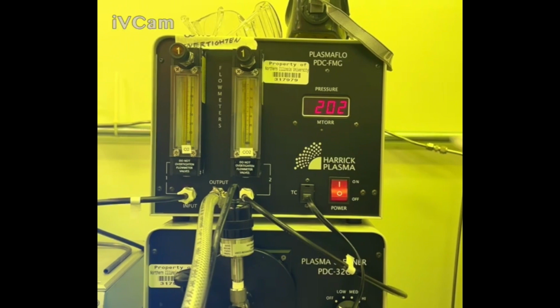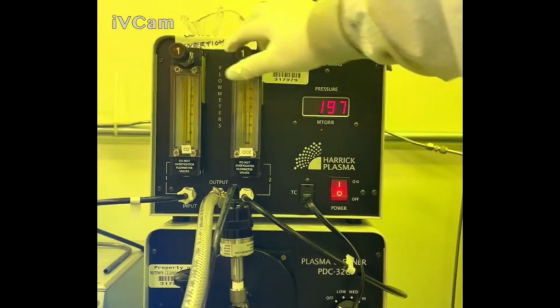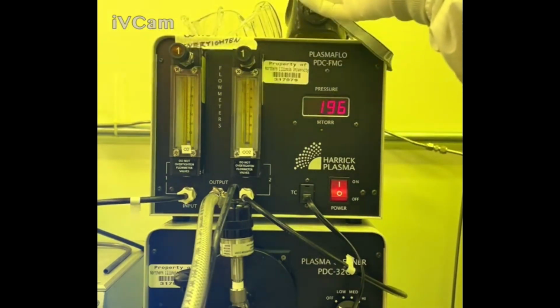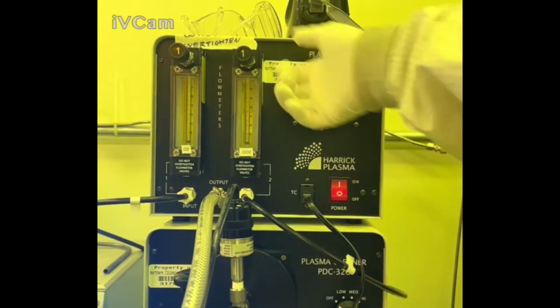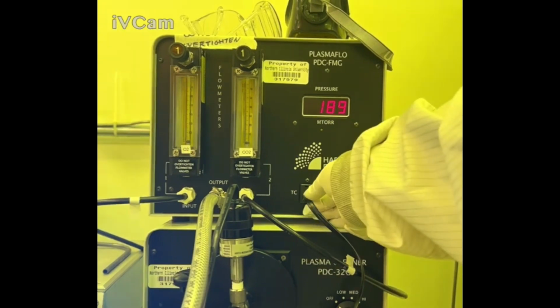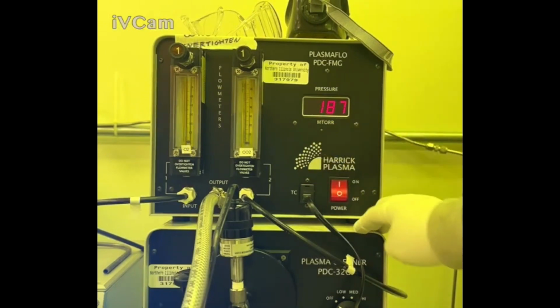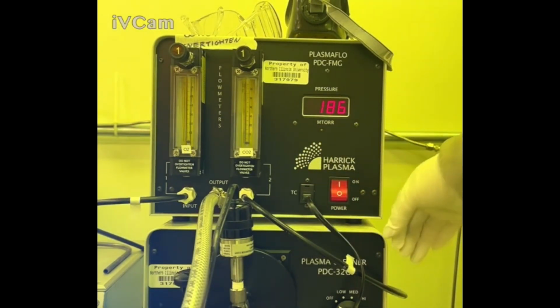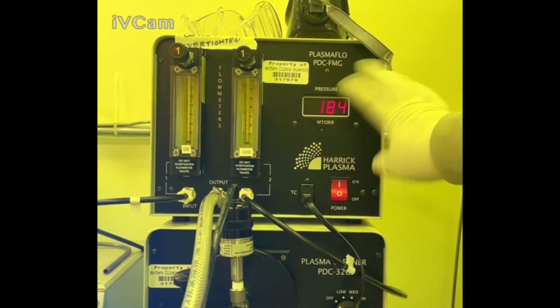If for any reason this is not reading at 150 and it's stuck at 1 mTorr, make sure that these are closed, but do not over tighten them, because then if you do, the threads on the inside of these fasteners are going to get loose, and then we can't really control it anymore. The other thing is that sometimes this is a little sensitive, so just pushing it in might return whatever sensor is in here to a readable value. So this might jump from 1 to suddenly 500 or something like that.